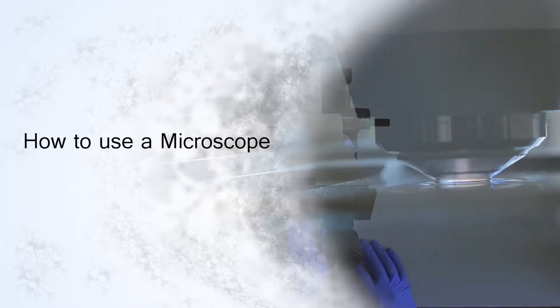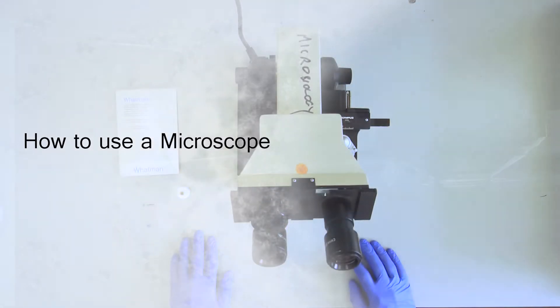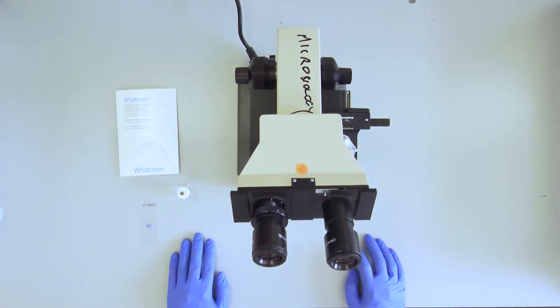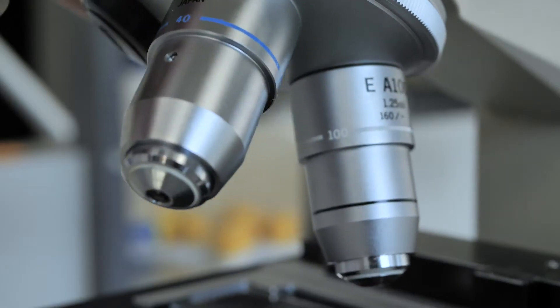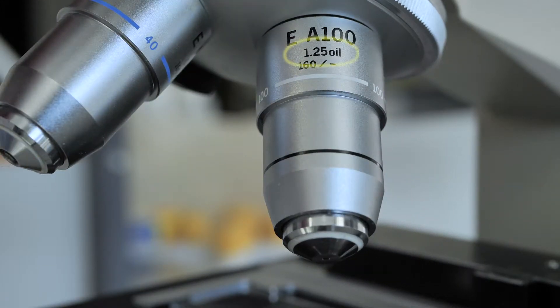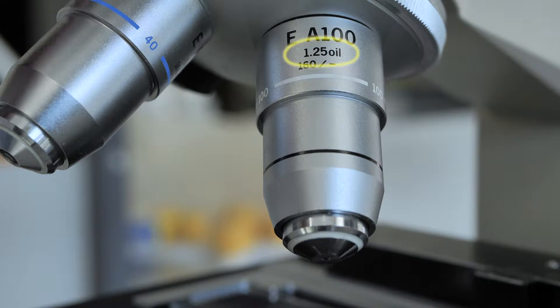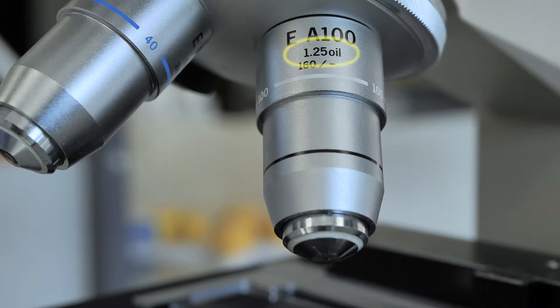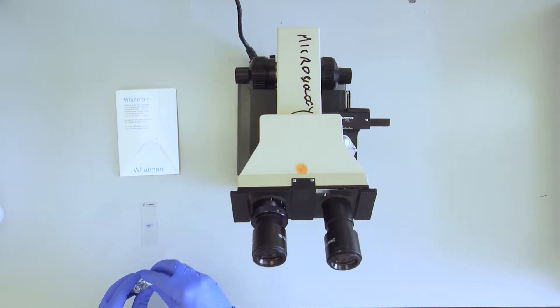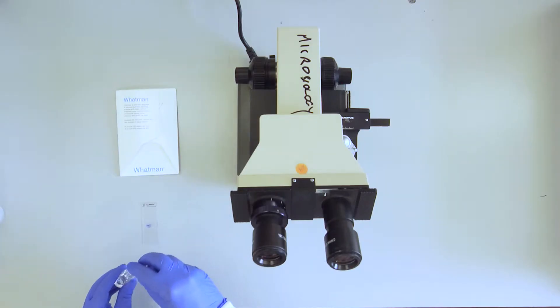How to use a microscope. You will use the Oil Immersion Objective Lens in order to view the bacterial cell morphology.